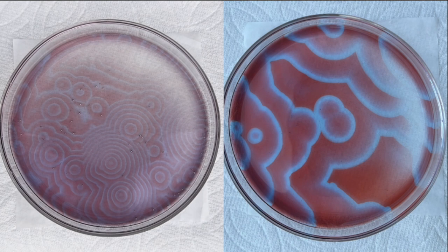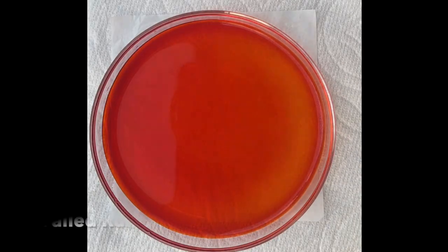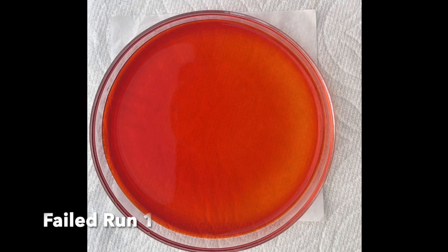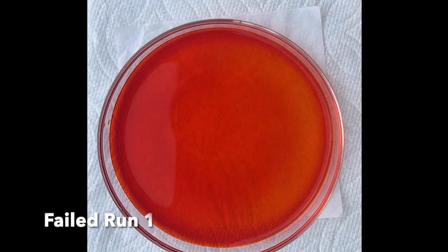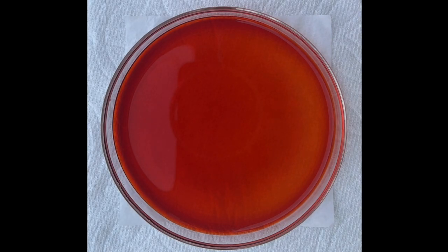However, when adding cerium to the equation, we've introduced a whole new dimension of complexity into this already quite complicated system. That means, despite my best effort to maintain consistent reaction conditions, every now and then it wouldn't form any patterns at all. This could be because I'm using a highly scientific method of measuring cerium solution by adding 2 drops each time. Yep, using drops to measure volume, that sounds very scientific.